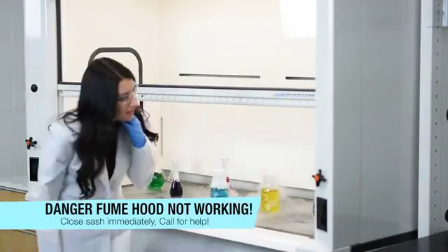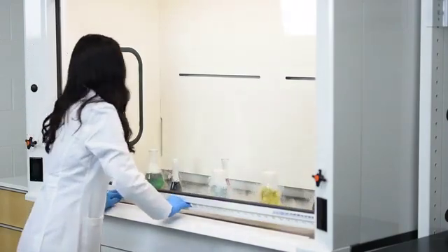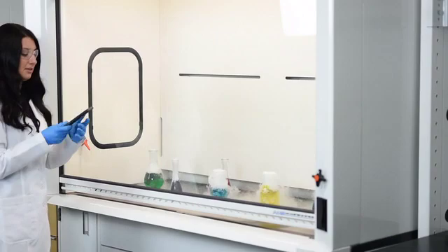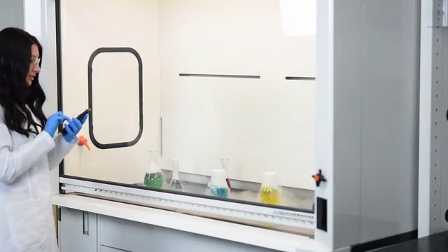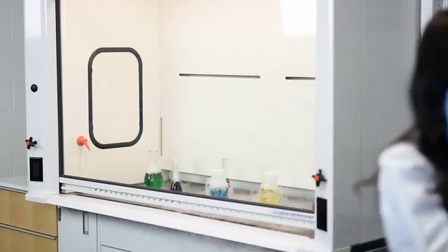This doesn't look good at all. If you see your hood is not functioning correctly, immediately close the sash and make a phone call to the appropriate personnel that help with the situation. Do not stay in the room as your air may become contaminated and harmful.